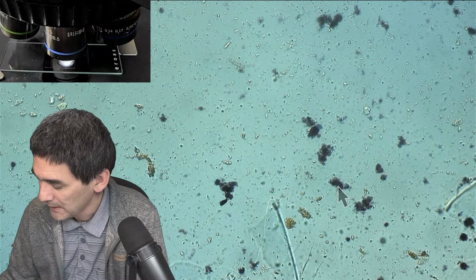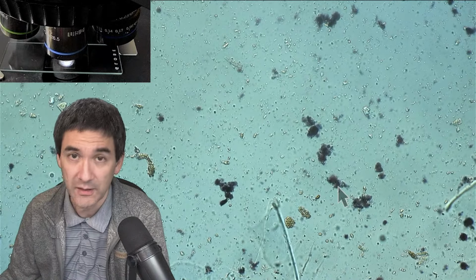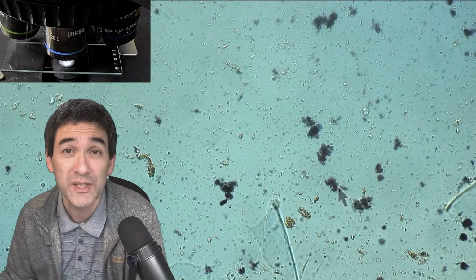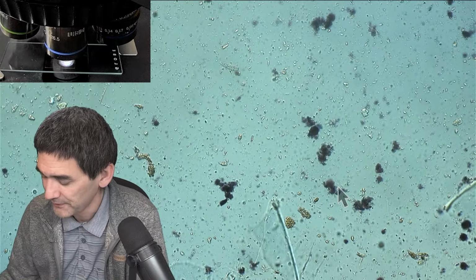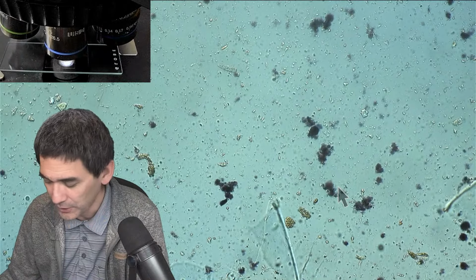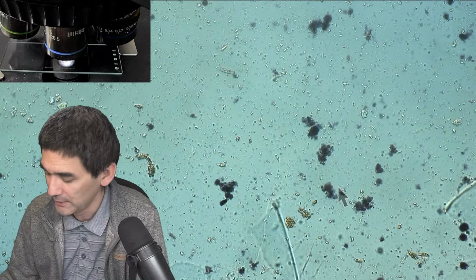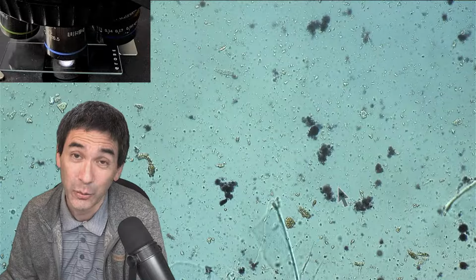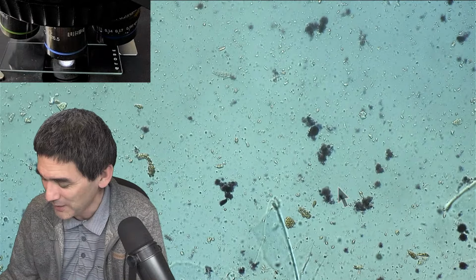Have you ever watched sea monkey shrimp hatch under the microscope? I've watched sea monkeys several times already, I think also a few times in this live stream, but I have not actually seen them hatch. I simply found them after they hatched. Would love to see a brine shrimp live stream soon. Yeah, I gotta get some more of these brine shrimp because the pack that I have is a little too old. Once they become too old, not many of them hatch anymore.